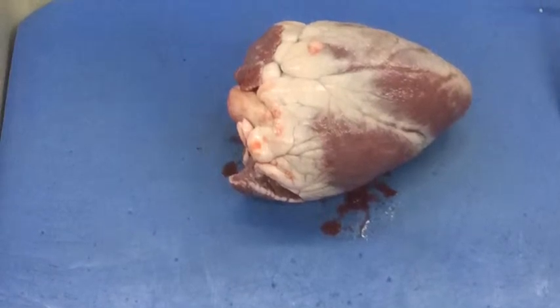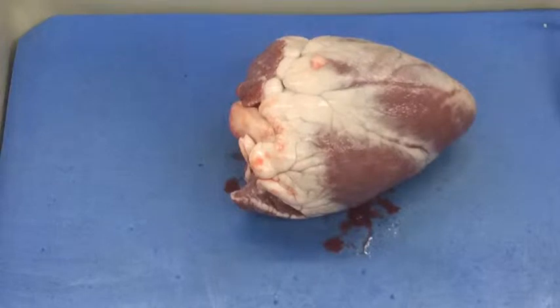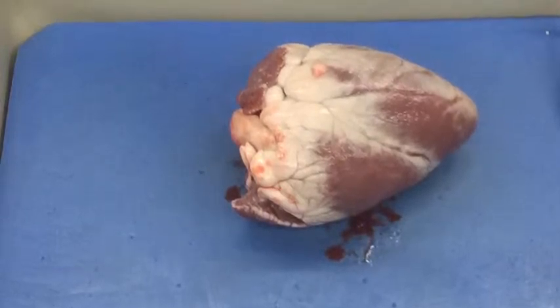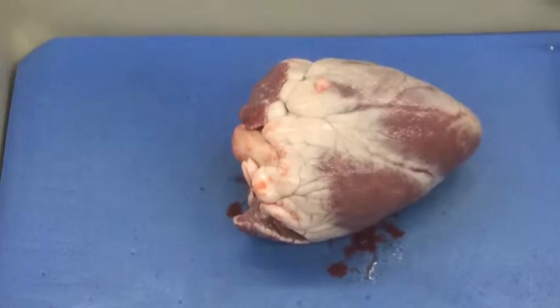The heart here is about the size of a baseball and the color of the heart muscle is dark purplish with a little bit of red and brown, and it's covered in fat. Yes, we did see the liquid move inside — that's why there is some blood on the bottom of the tray.